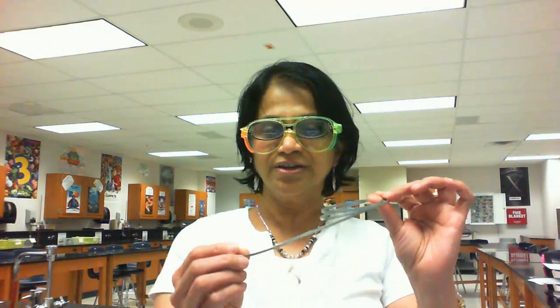So let's move on to our third reaction, and what we are going to do is take the same magnesium ribbon, and we are actually going to oxidize that by burning it in a burner. Yeah, it's going to be fun. So let me cut a small piece of magnesium ribbon, and let's go near the burner.